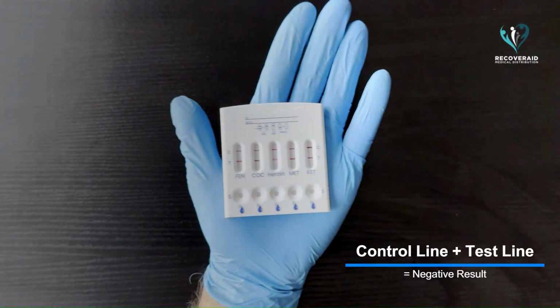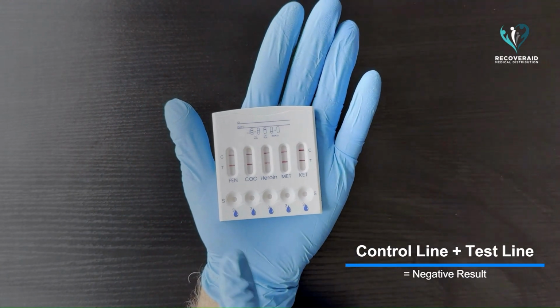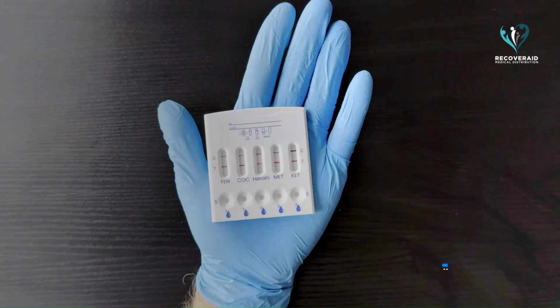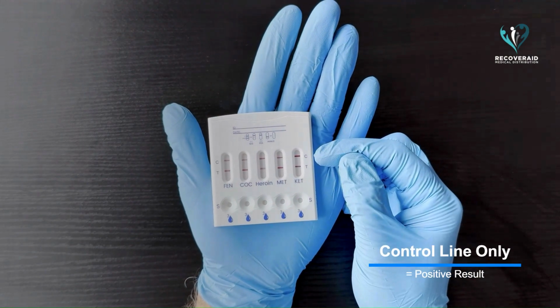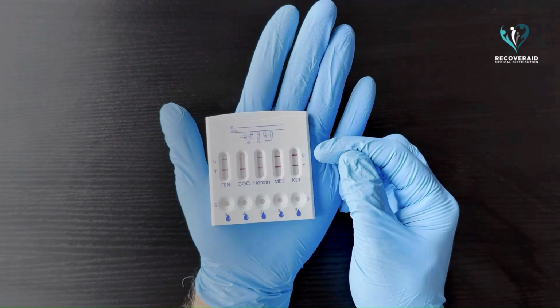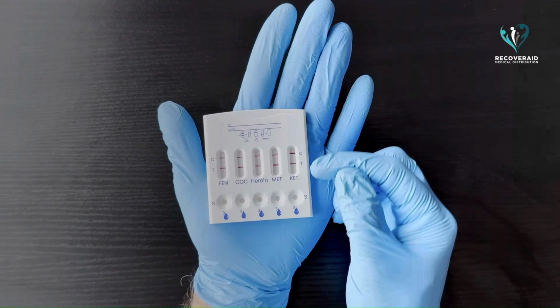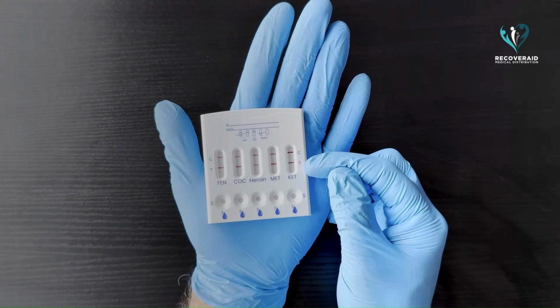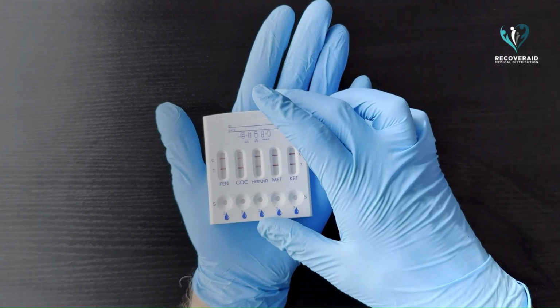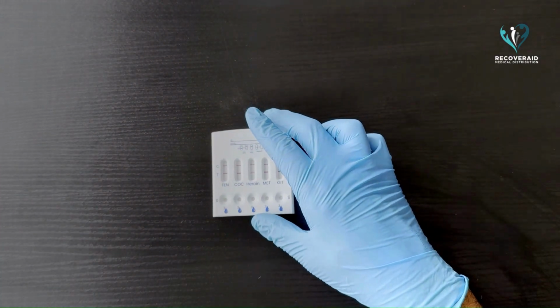If both the control line and test line appear, the result is negative. If only the control line appears and the test line is absent, the result is positive. The control line must always be present for the result to be considered valid. If the control line does not appear, the test is invalid and should be repeated using a new test cassette.